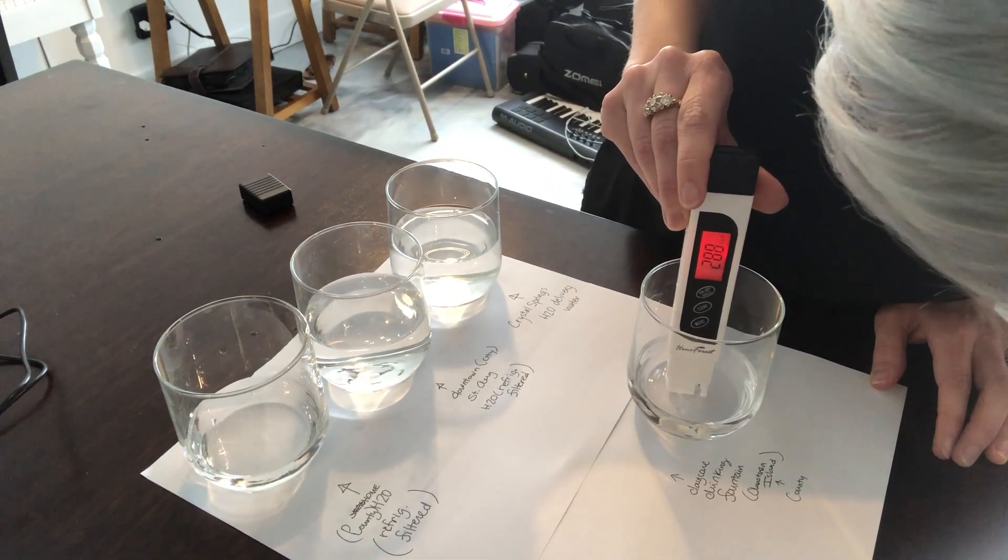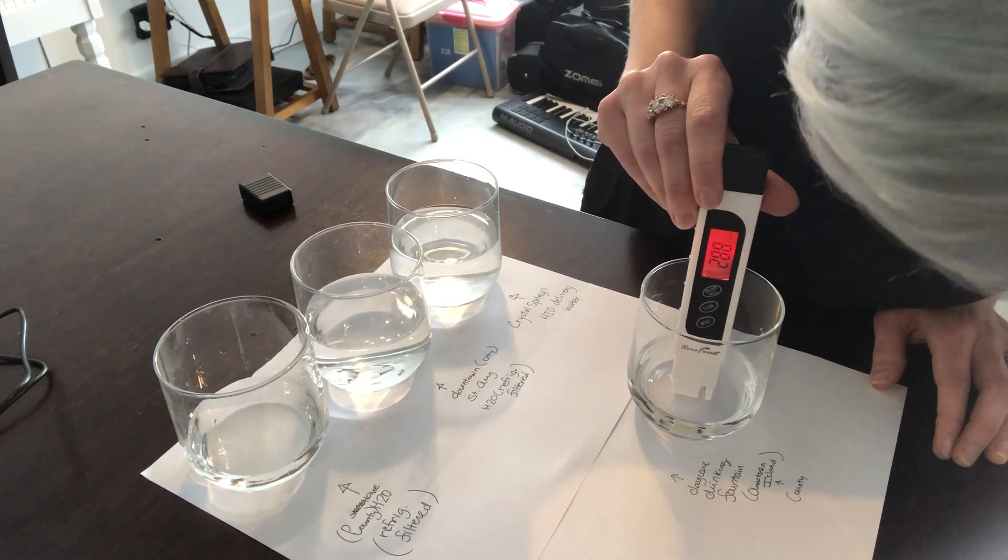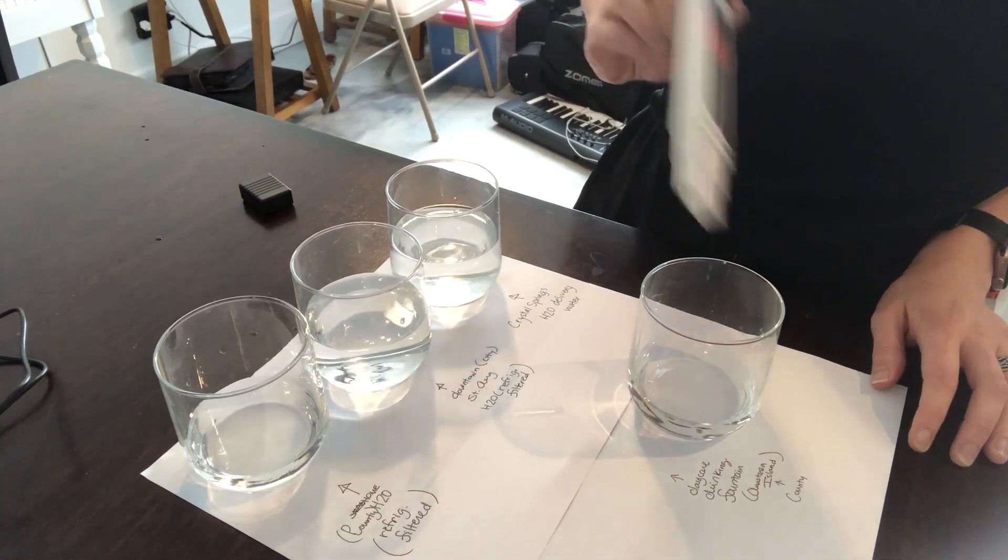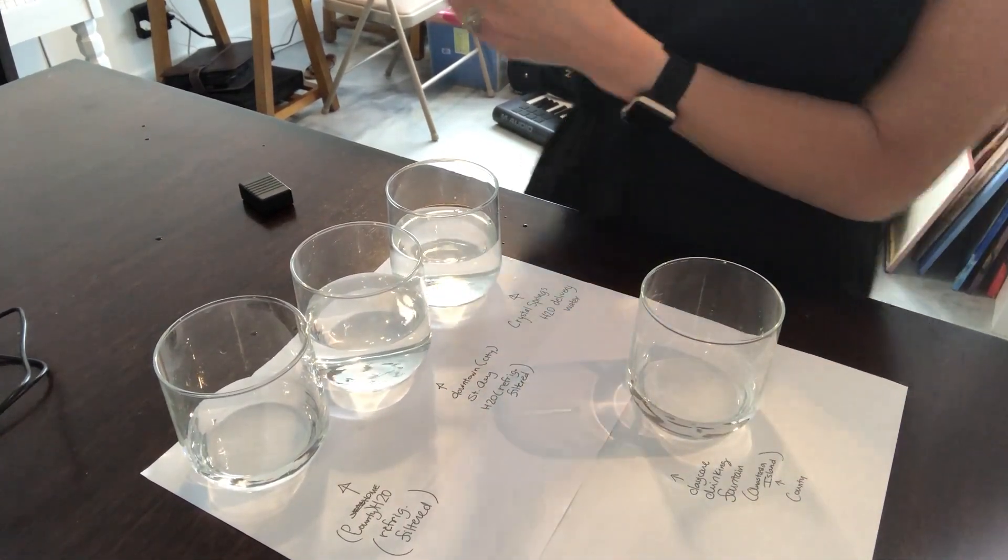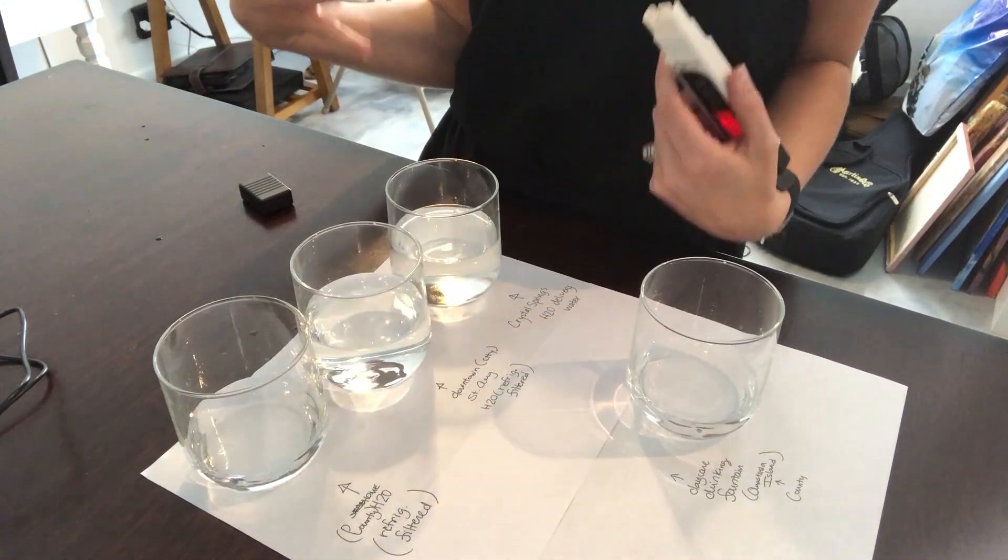This is also saying 288, which is interesting, very similar to what we had for the downtown water. So that's actually a lot better for some reason in this house and this neighborhood maybe.